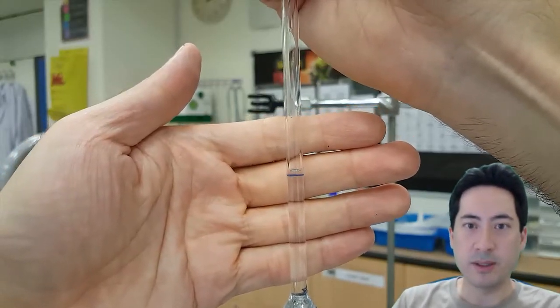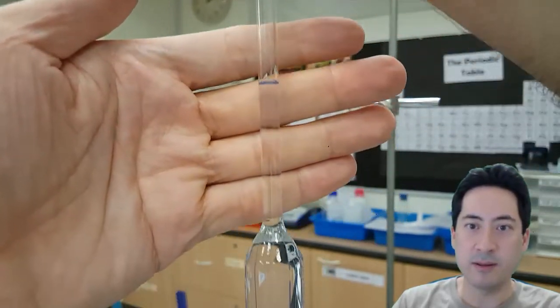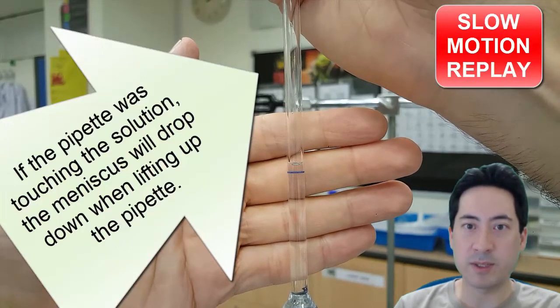Be aware too as you're putting liquid, as the pipette's going in and out of the liquid, it pushes down on the meniscus. And as you pull it up, gravity kind of the force kind of lets it jump down.